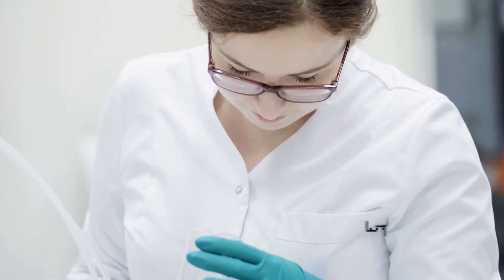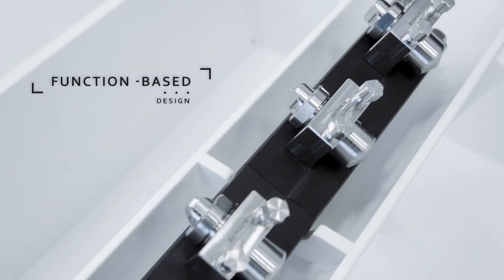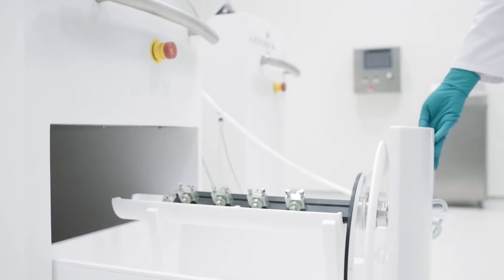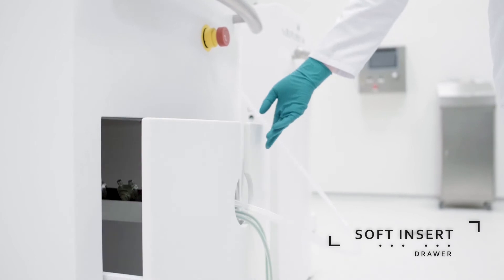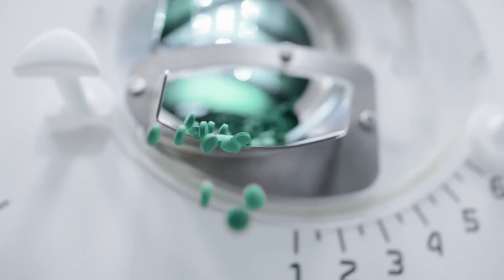After coating, the complete nozzle arm including the hoses can be dismantled and stored in the drawer intended for the purpose. The drawer provides sufficient space for all additional tools and other equipment. The contents of the drum are drained.